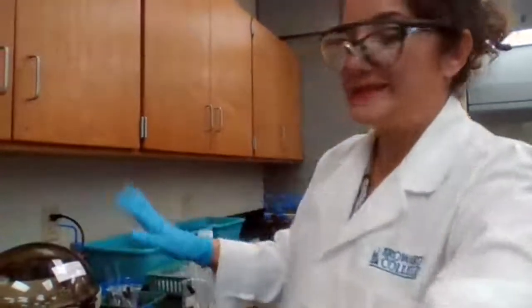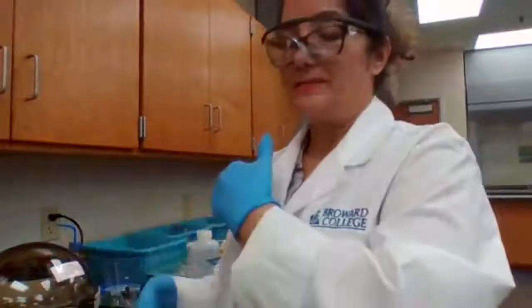Now wait until it stops. I repeat because I'm trying to make better use of the time and be more efficient, because we don't want to just wait and not use the time. I'm trying to emphasize the techniques.